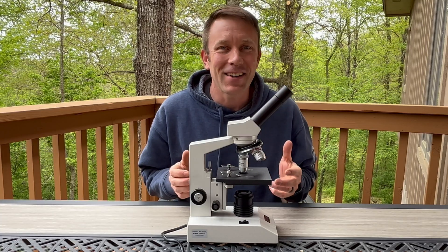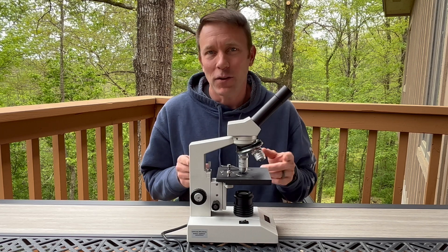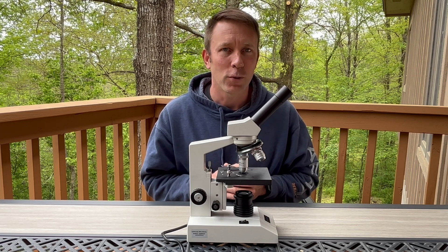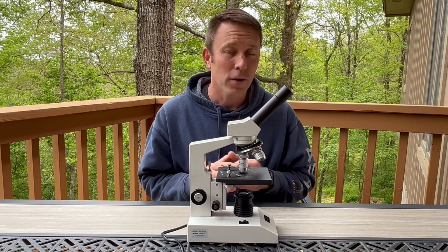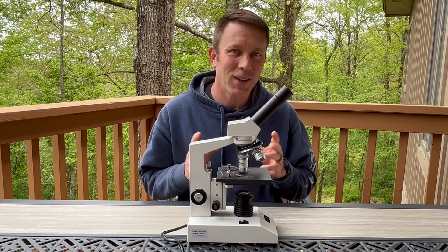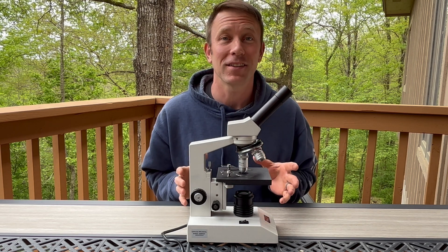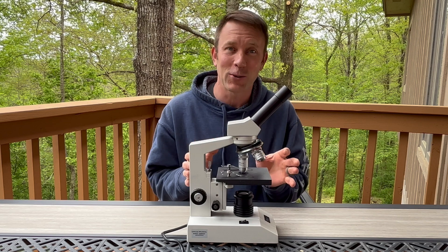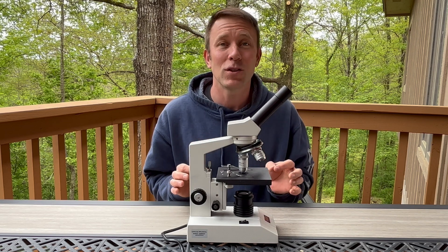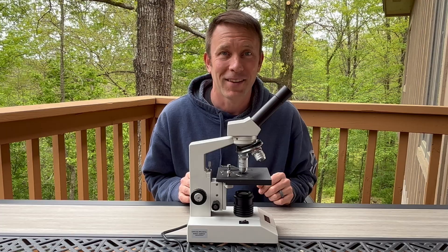Let's go ahead and give this a try. You can look at slides that have already been prepared for you, or you can make your own. Today I'm going to be making my own because I want to take a look at something pretty cool — the actual human cheek cells from the inside of your mouth.